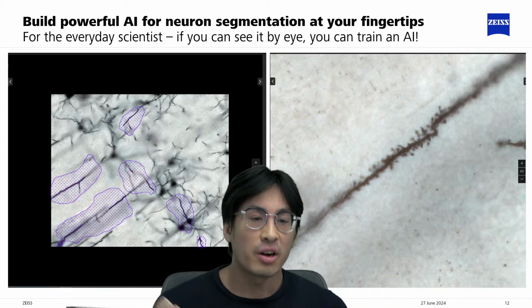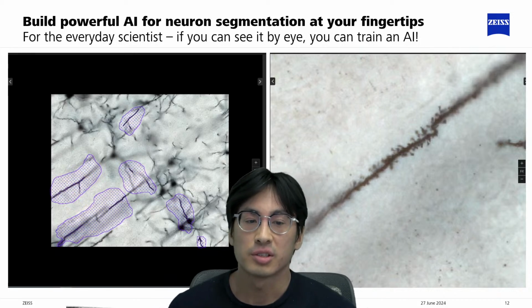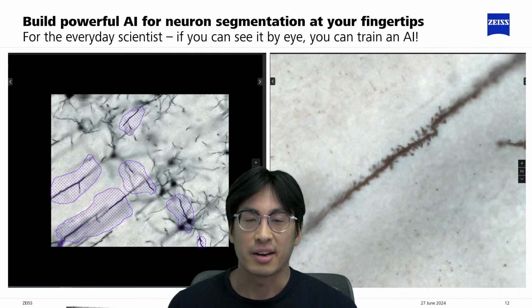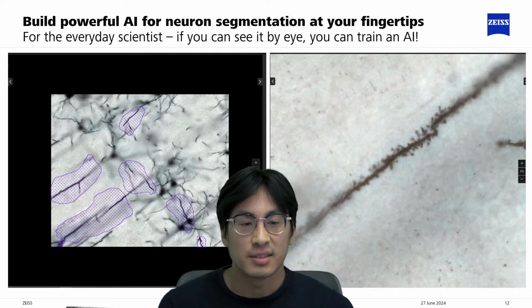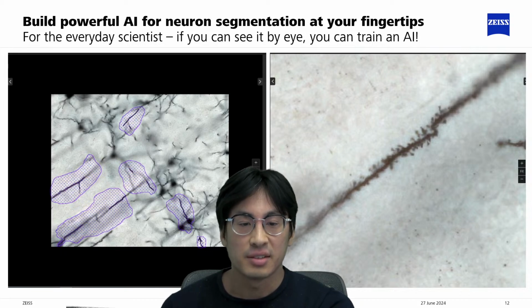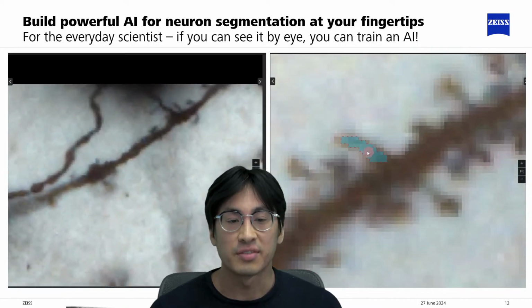And so how can we quantify our images? So the approach would be to segment the different components of these neurons. But then you would ask yourself, isn't detecting these features automatically and accurately a really hard problem then? Well, ZEISS arivis solution has powerful AI platforms on the cloud, such that an everyday scientist can train their own state-of-the-art custom deep learning model that's tailored to solve specific challenges.